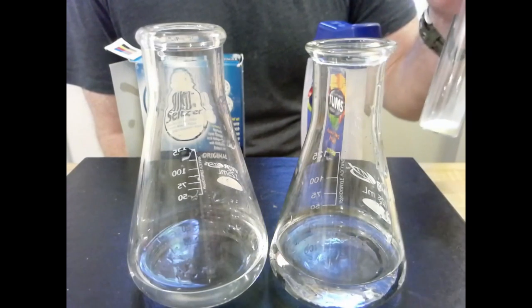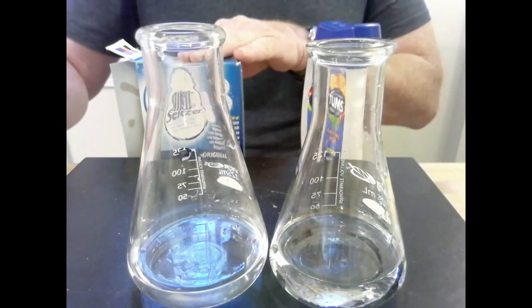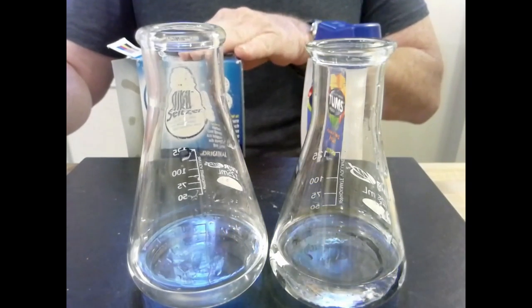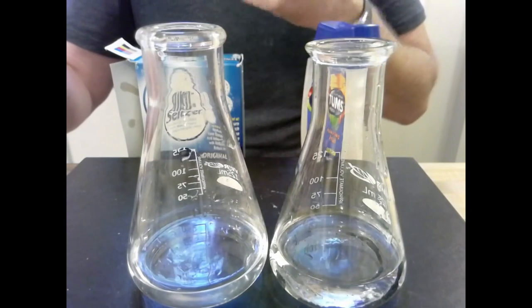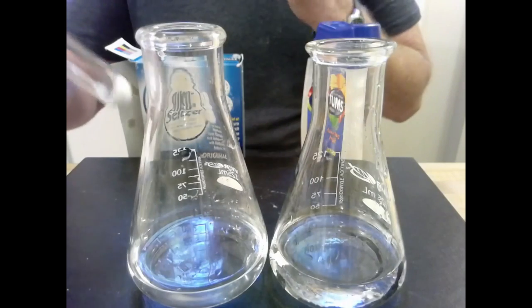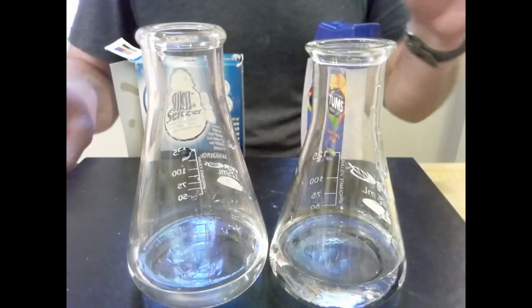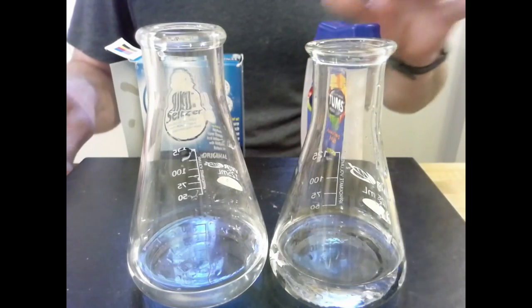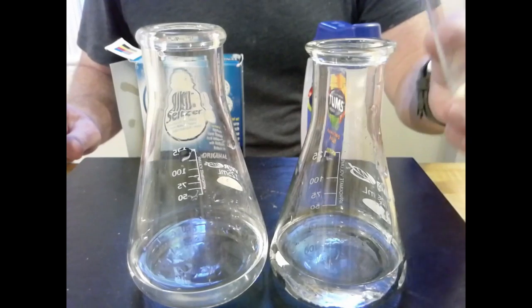So what I've gone ahead and done is to crush this into a powder. And on this side, it's meant to be dissolved in water and drunk that way so that it's completely brought in. We're doing the same exact thing on this side, just crushed into a powder. We're going to start with this side so that we can see the reaction in our acid. So here we go.